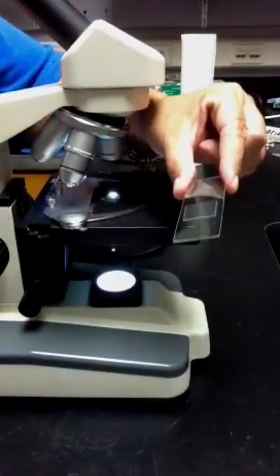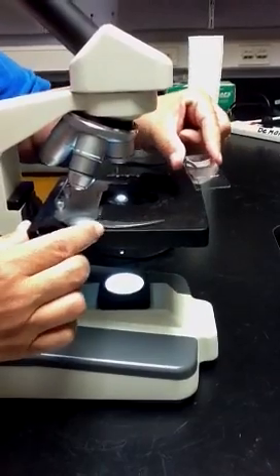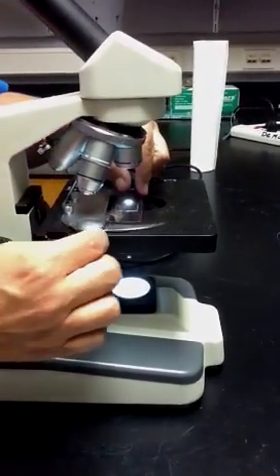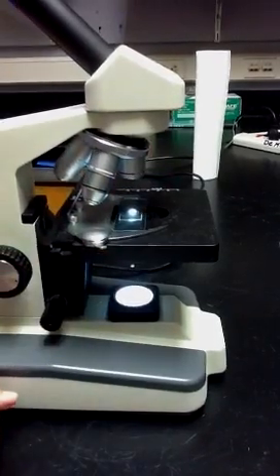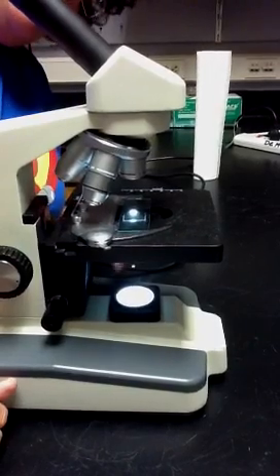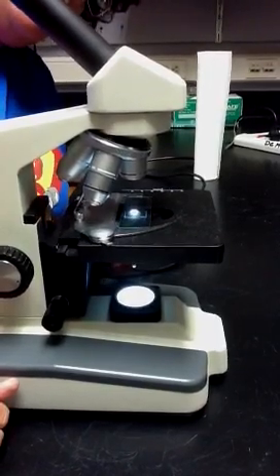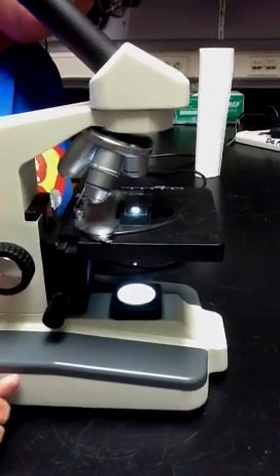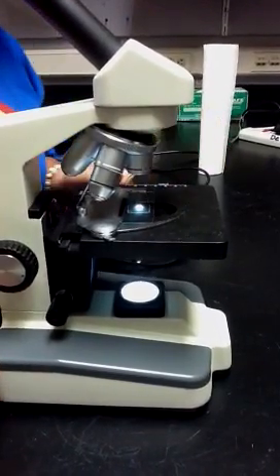To put a slide on the microscope, you just open this little arm here and place the slide carefully onto the stage, and it will be secured into place. You can use the manual adjustment knobs to center your specimen right over the iris or the light source on the stage.